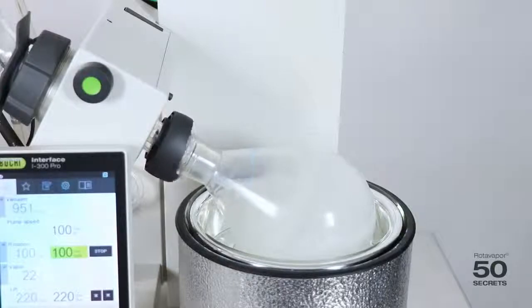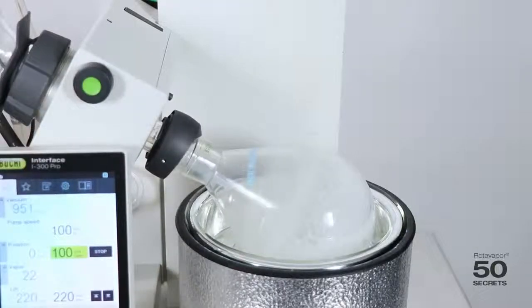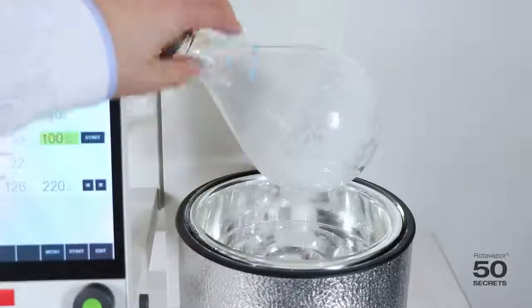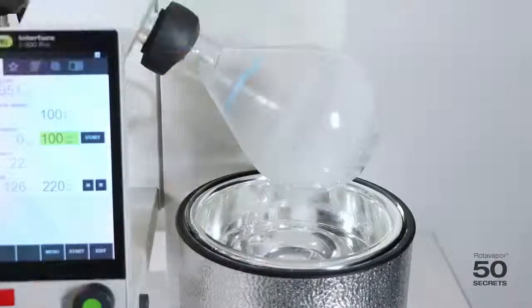Once the process is finished, you just stop the rotation and take the flask out. And you can see the very nice crack pattern over here, and the very evenly distributed ice inside the flask.